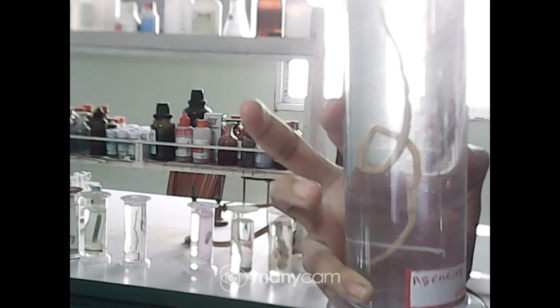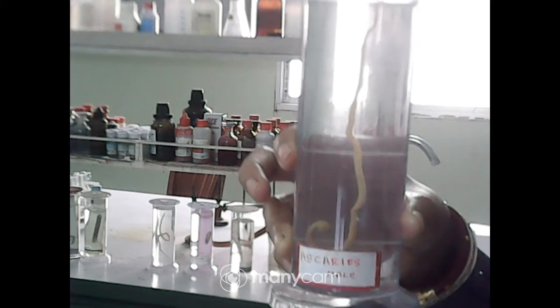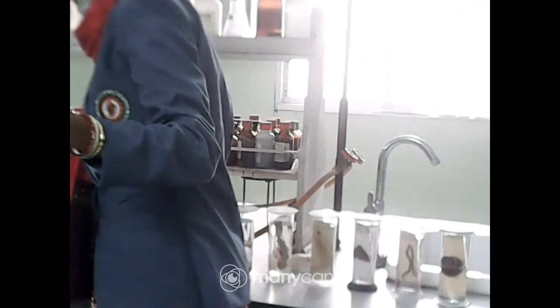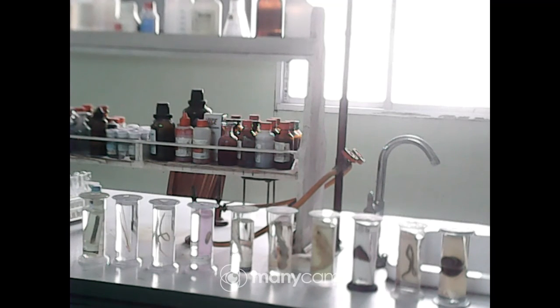Here is Ascaris female, and here is Ascaris male. Here is leech. And here again is Fasciola hepatica — so you can see all the specimens.